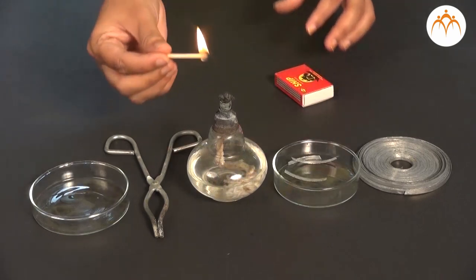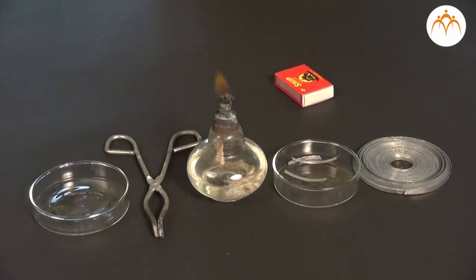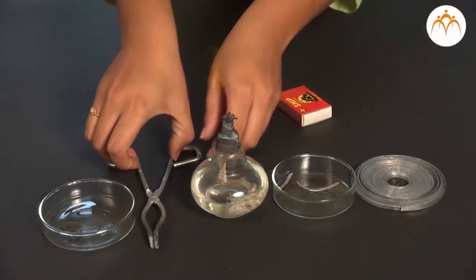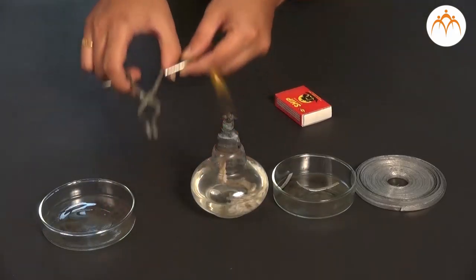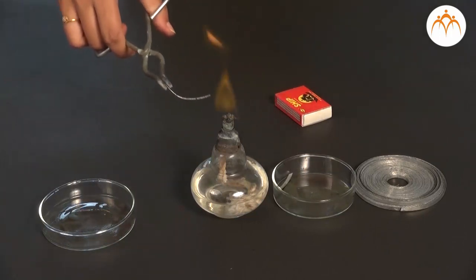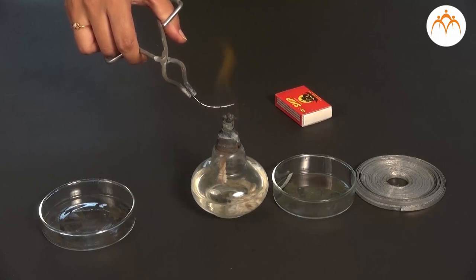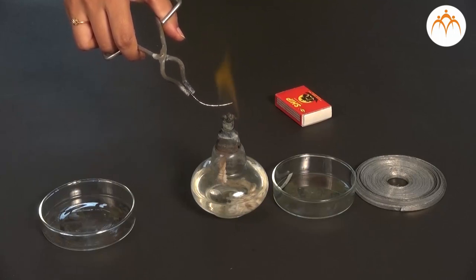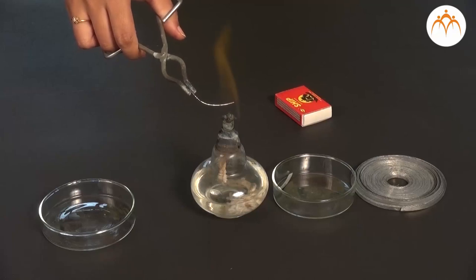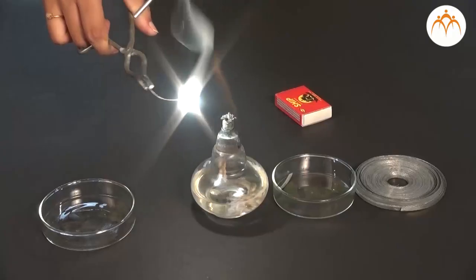We need magnesium ribbon for the first experiment. We are going to burn a small piece of this ribbon in air. We hold a small piece with a pair of tongs and burn it using a burner or spirit lamp flame. We collect the ash in the watch glass or china dish. You will observe that magnesium burns brilliantly with a luminous flame and white ash is left behind. The flame is very bright.